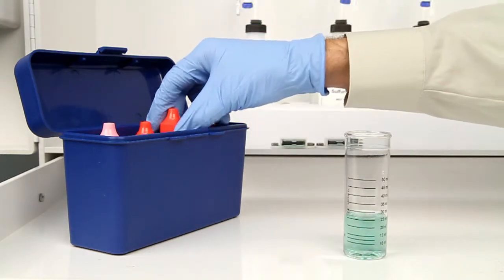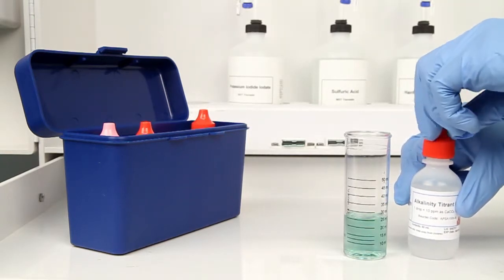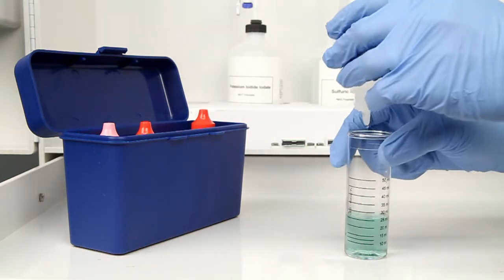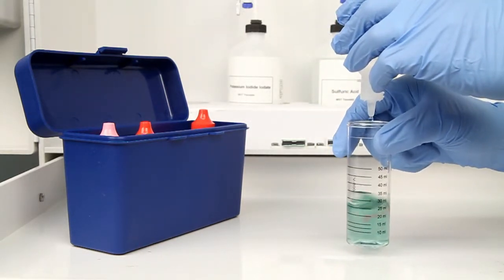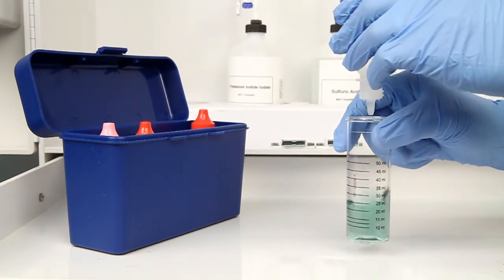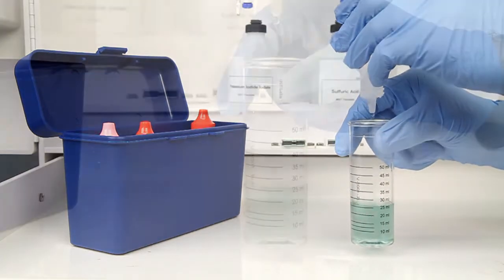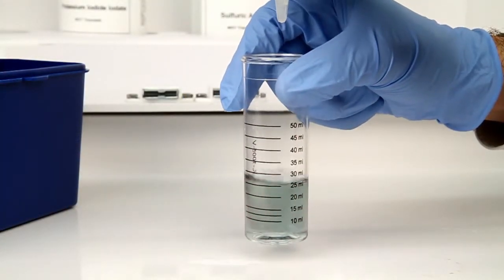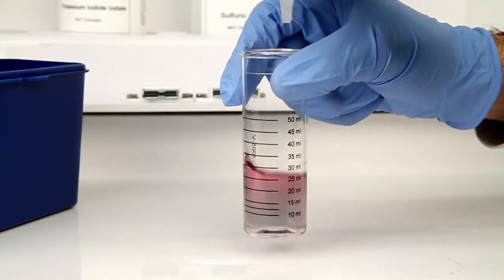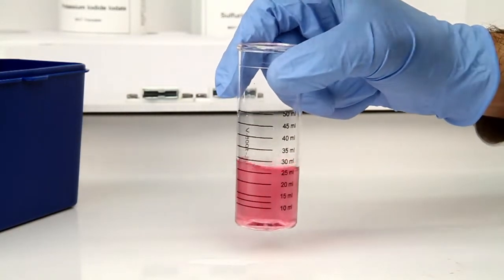The next step according to the Endpoint ID procedure is to perform the titration. Each bottle of titrant is labeled with the equivalency and sample size it was manufactured for. It's important to make sure you have the proper titrant and the proper sample size for this titration. The bottle of titrant contains a dropper tip, therefore it's important to hold the bottle vertically to make sure you get a consistent drop size. After the addition of each drop of titrant, swirl the vial to make sure the sample is properly mixed. The titration is complete when the sample changes from green to red.